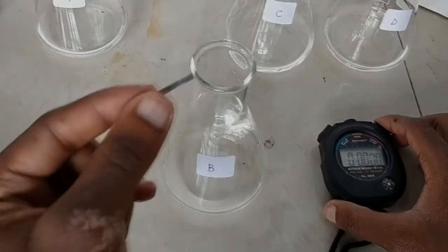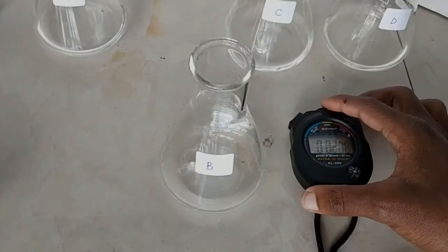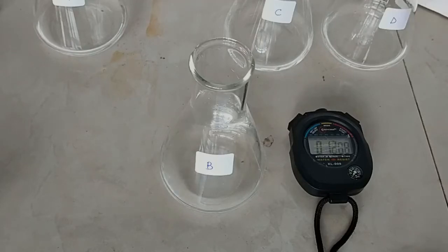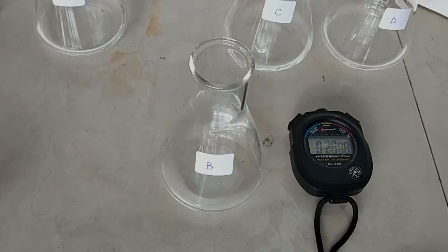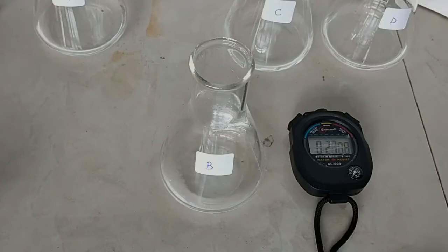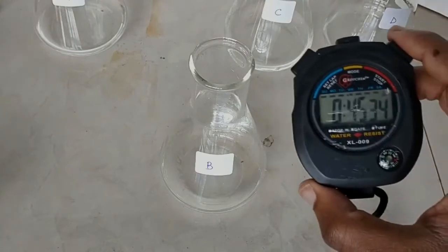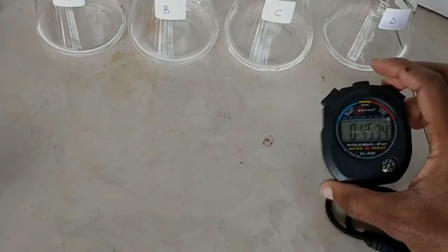Now for the second one, on flask B, I'm going to drop the magnesium ribbon and immediately start my stopwatch — keep your eye on the magnesium ribbon. That's it — 45 seconds. I go and record this in my data book; remember, don't record the milliseconds.